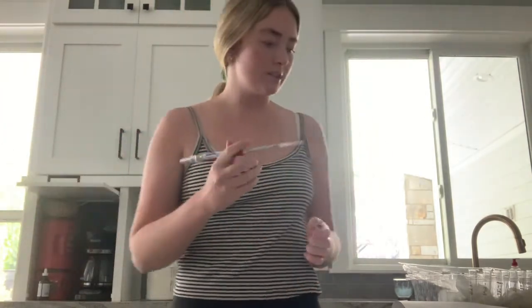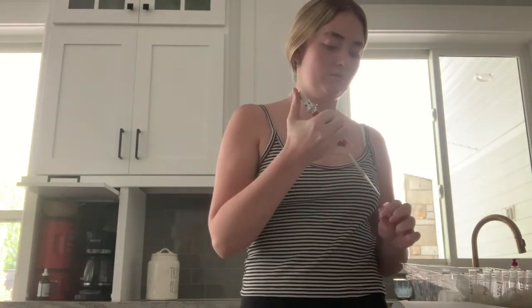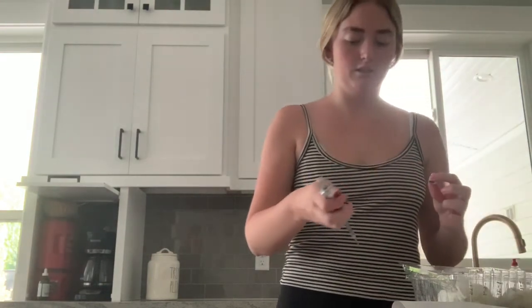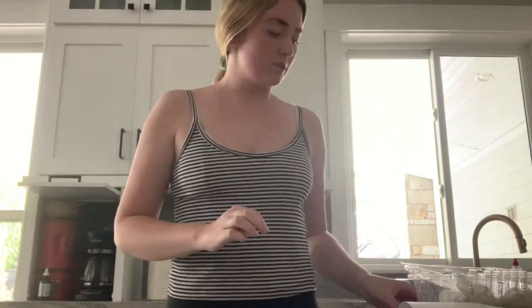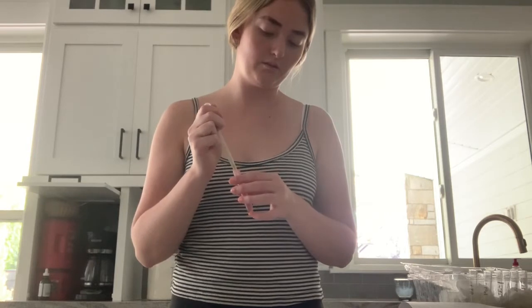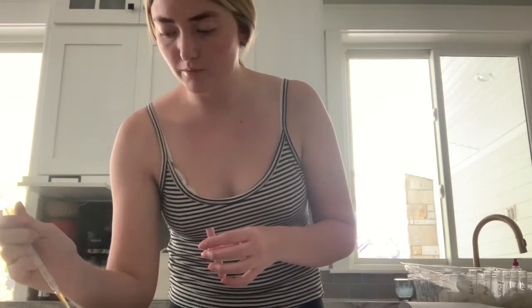Okay, so now we take 200 microliters of our urine sample and we put it in our first test tube. We're going to also take 1 drop of the urine sample and put it on our first ketone tablet as a control to show what a positive would look like. We just do 1 drop.